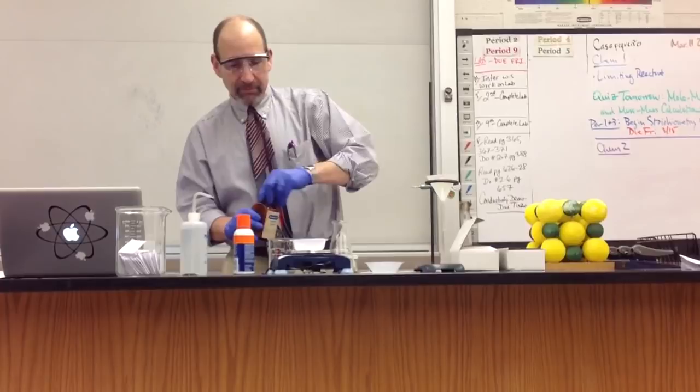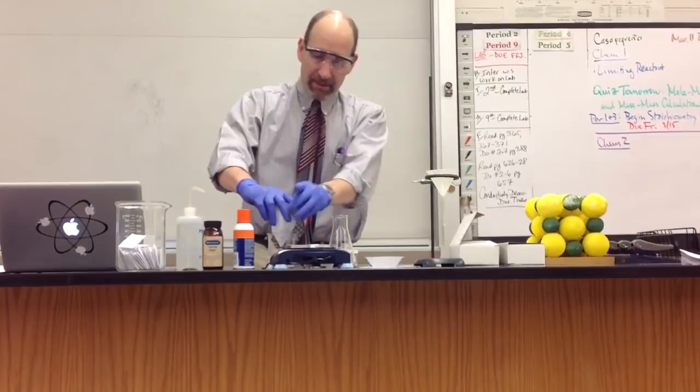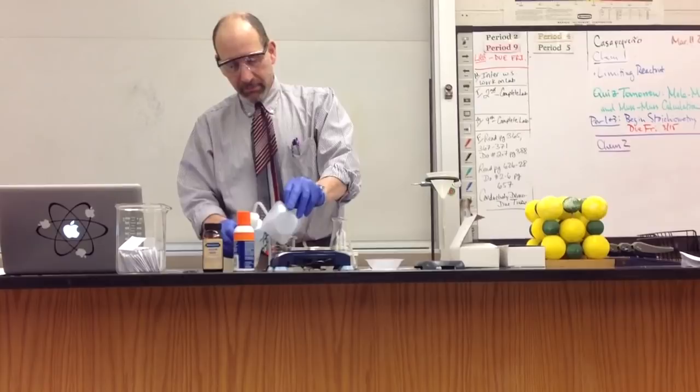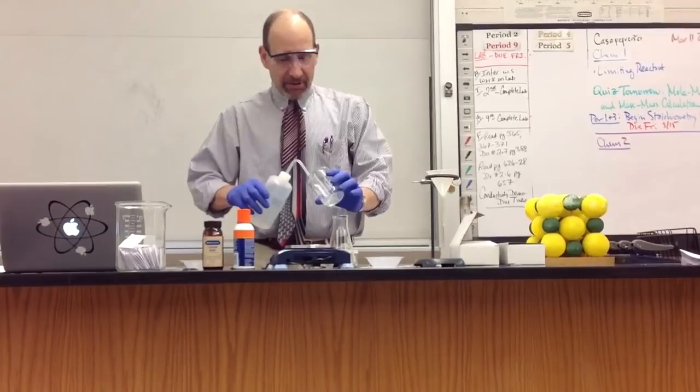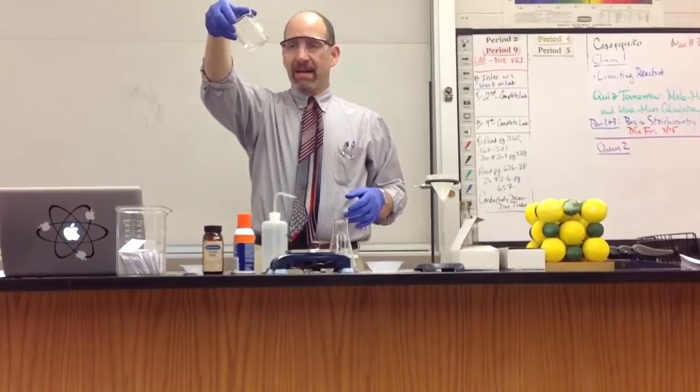And it tells me to put that in the beaker, I believe. And I'm going to rinse it down with a little water and dissolve the NAI. And it's very soluble. In fact, it dissolved right away. In the instructions, it said that you may need to heat it up, but you don't need to heat it up. I just realized there's no ice bath. I'm not going to end up using an ice bath because I don't have one.